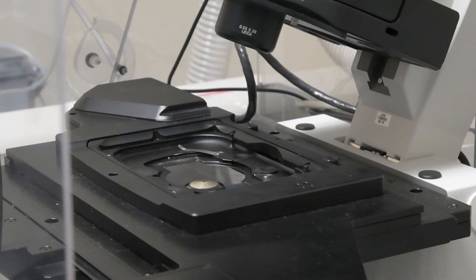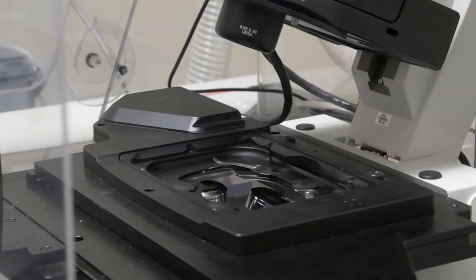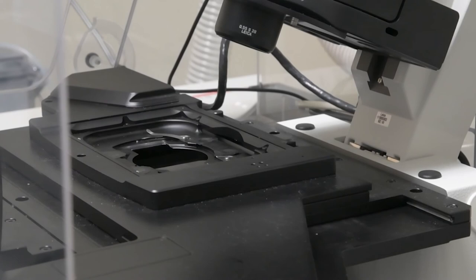Now for purposes of this demonstration I'm going to hit yes just to show you what happens. So this is what happens if you hit yes. The stage moves to the four corners and stops in the middle. Anything that's in the way is going to get run over or crushed.